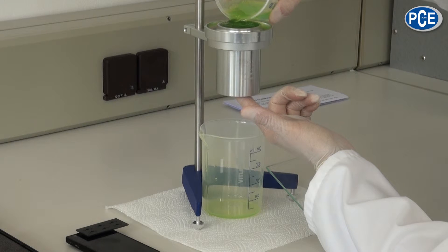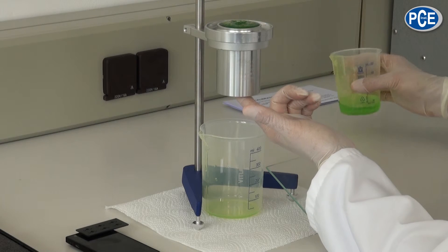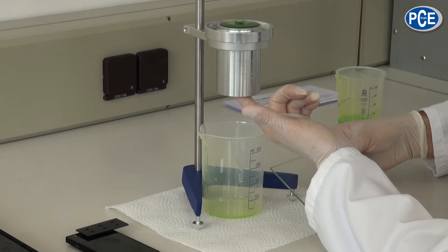When the fluid goes over the rim, the excessive fluid can be removed with a glass plate.